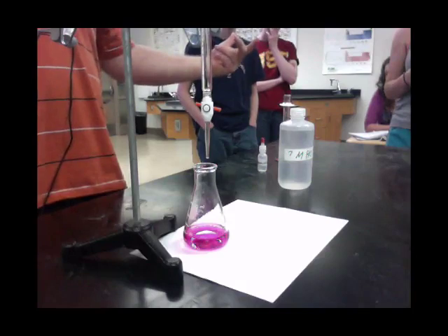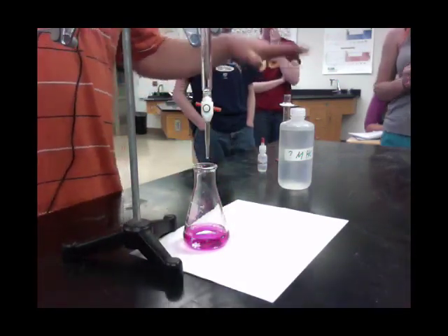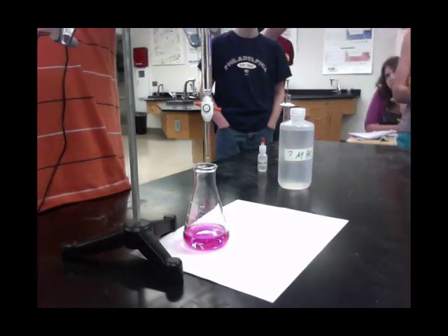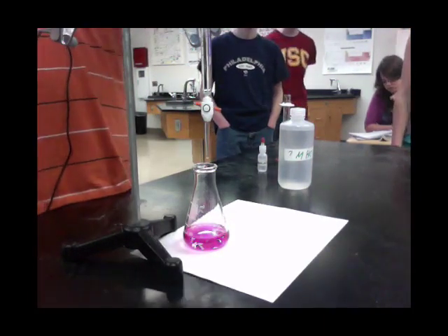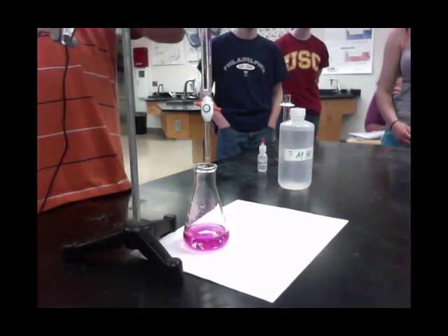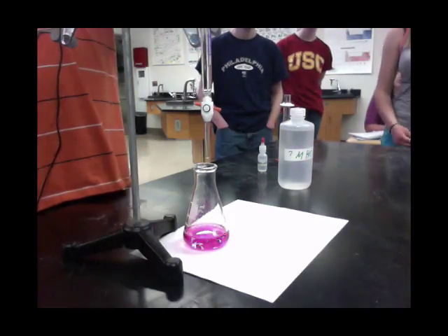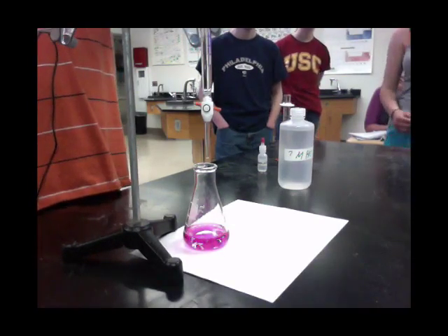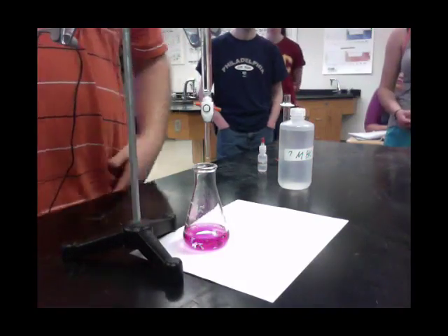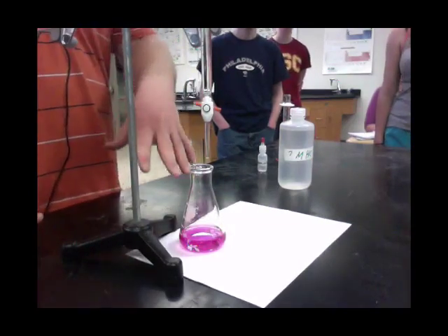You can't just randomly subtract that away. So if you wanted to redo it, you'd take this out and fill this back up again. If I'm at 18 here, do I need to refill the burette? No, because it goes down to 50. So I could pour out — this is about 15 milliliters — and definitely redo it at least one more time before refilling. For time reasons, we're not going to do that now.